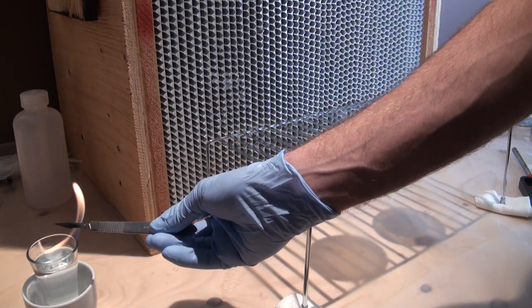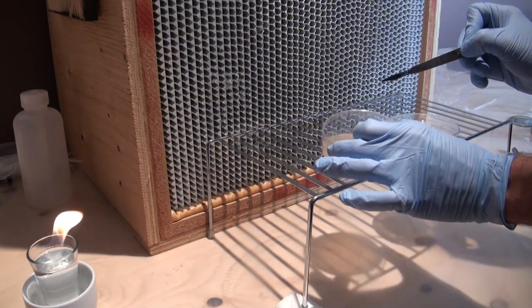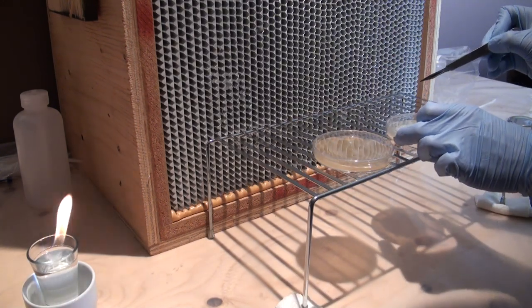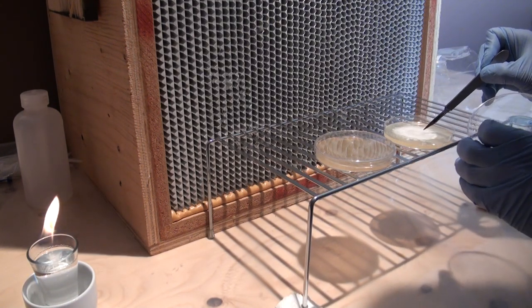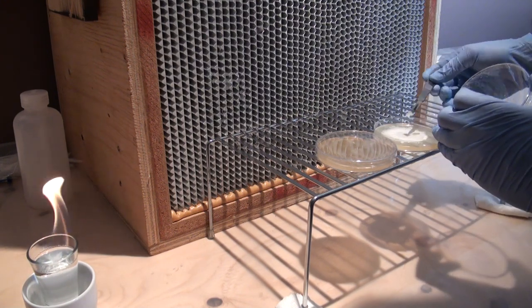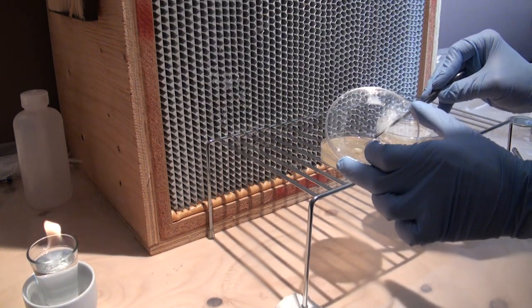Once it's literally red hot, take your scalpel and first cool it in the receiving dish. Then go ahead and cut a piece of your mycelium and drop it into your receiving dish.